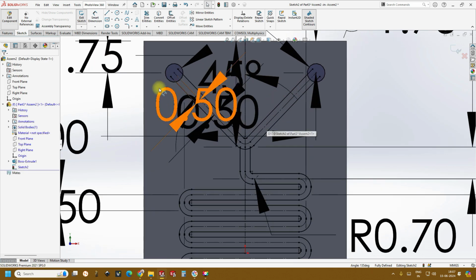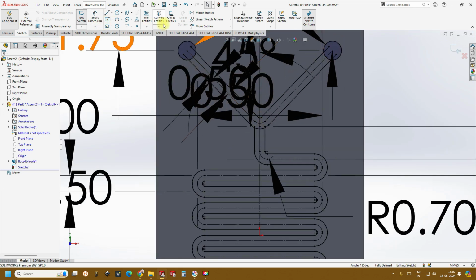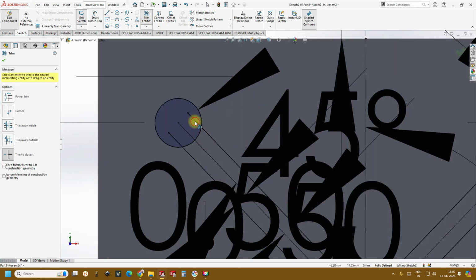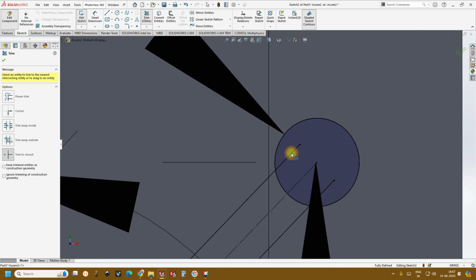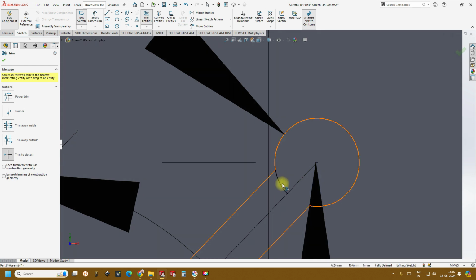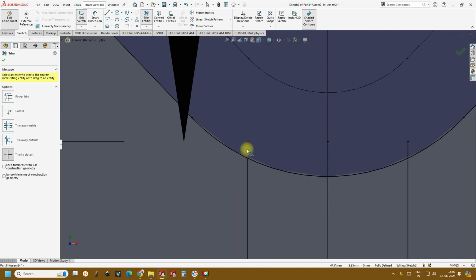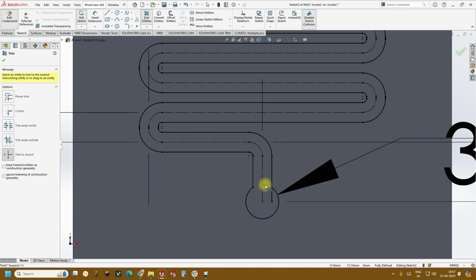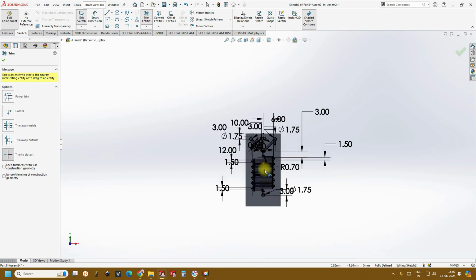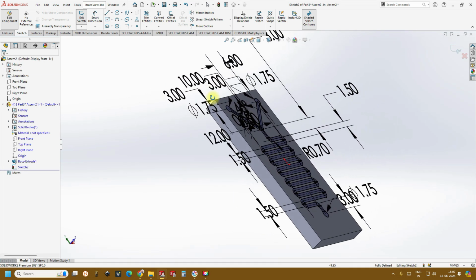Click OK. And now if you see, this is not an enclosed or closed loop because we are not seeing any highlighted portion. So that is why go to trim, remove the extra lines, just trim and remove. Okay, now you see this is a complete closed region, and in this, we don't need this, this, and this. Similarly, we don't need it here. Now if you see, this is a complete shaded region we are seeing here. So it is completely closed and it is ready for 3D extrusion.